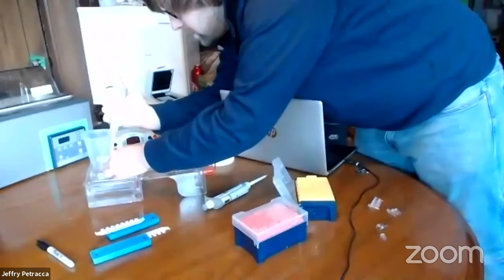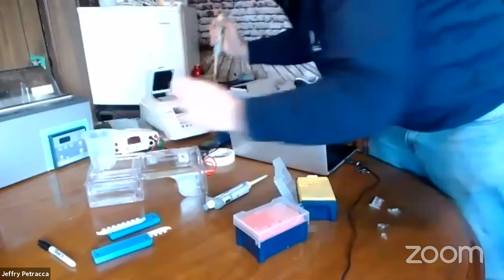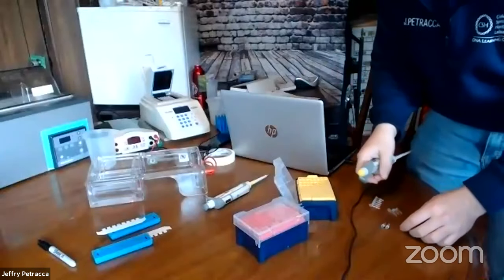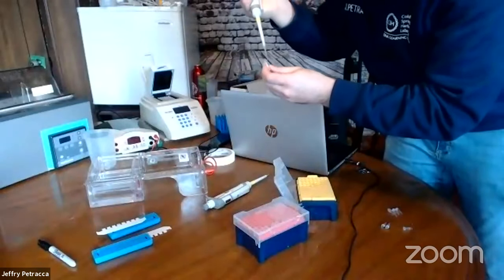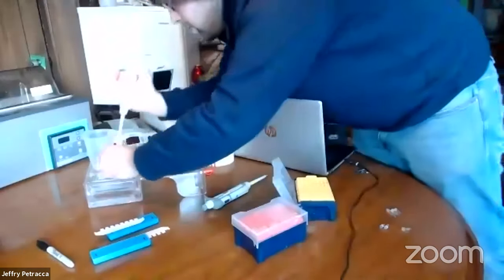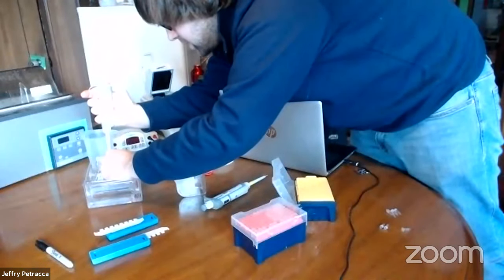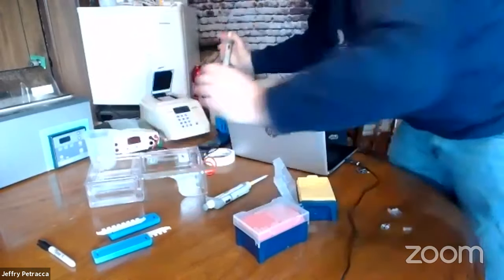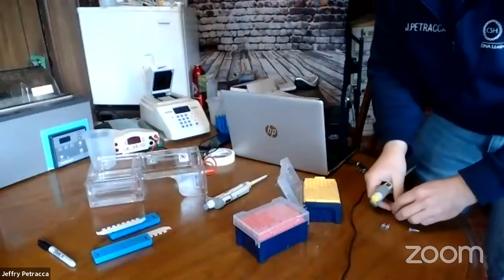I'm doing the positive control first. When loading the gel, you have to deposit your sample directly into the well every single time — you don't want to inject it into the gel or into the buffer, because otherwise it'll float away. I'm taking extra care to make sure that when I go into the well, I'm actually getting it in the well.